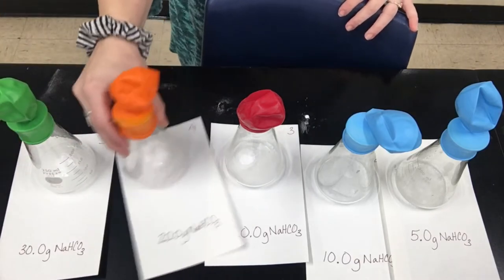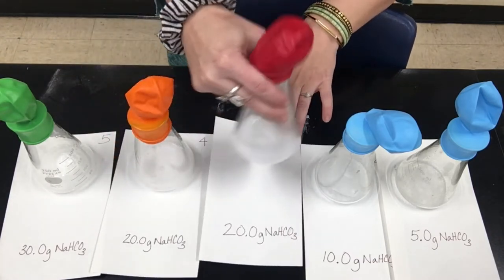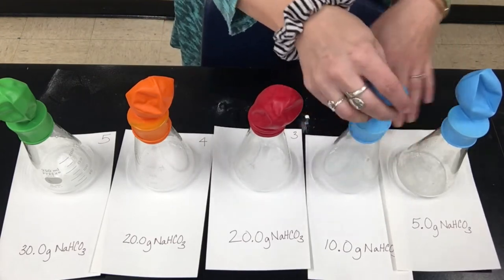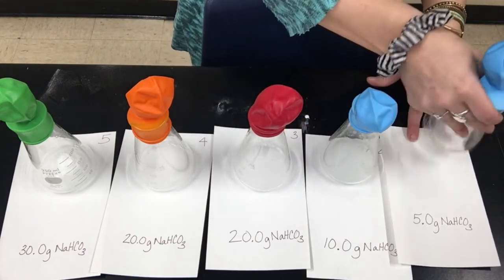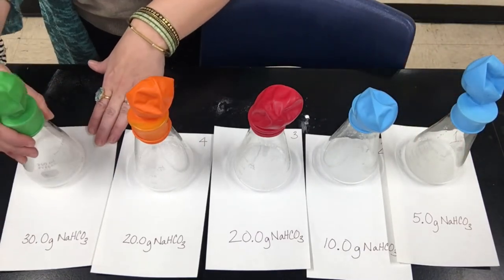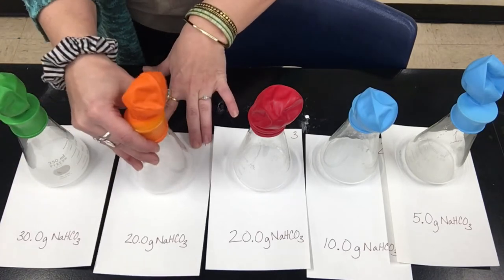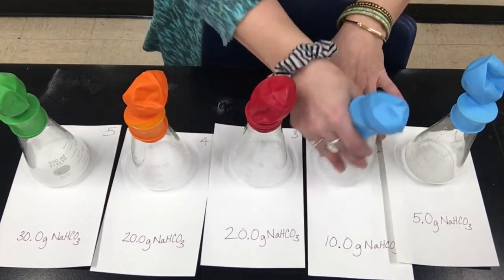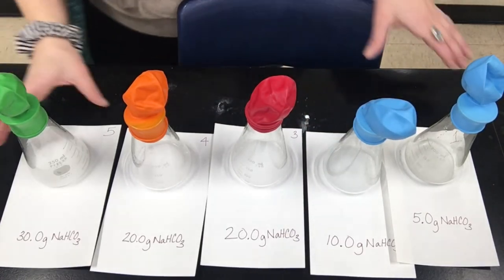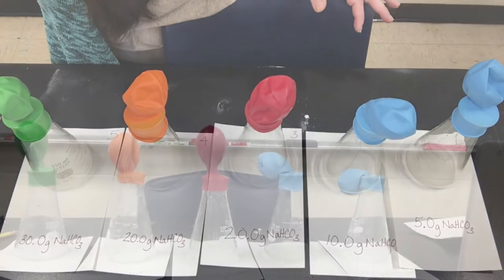I'm going to give these a little swirl to get our reaction to keep going. We're going to let these sit for a few minutes until the reaction has completely finished.